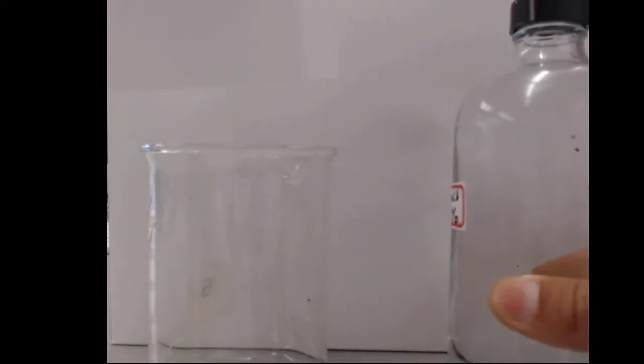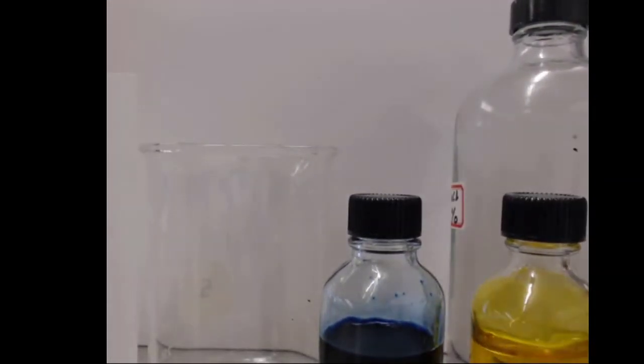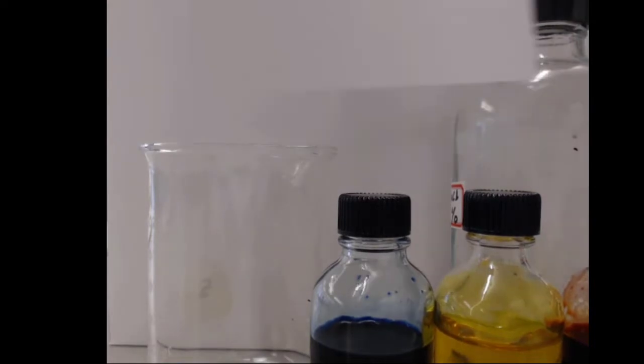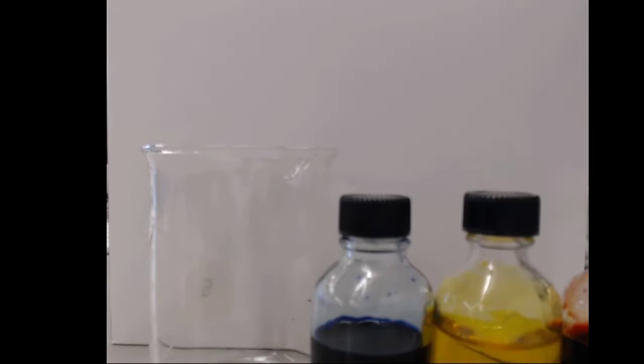And by using these two things, we'll be able to experiment with, in this case, different food dyes. We'll be able to tell whether they're interacting more with the polar molecules, the things with permanent dipole moments, or the nonpolar molecules, the things without permanent dipole moments. So we'll take a look at that, and we'll go ahead and set that up real quick.